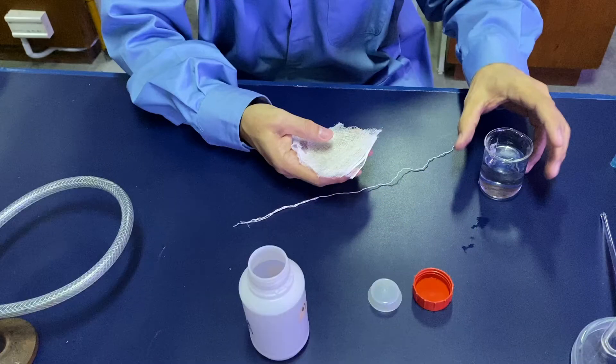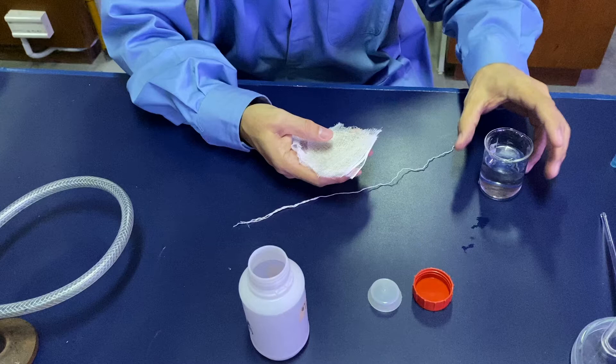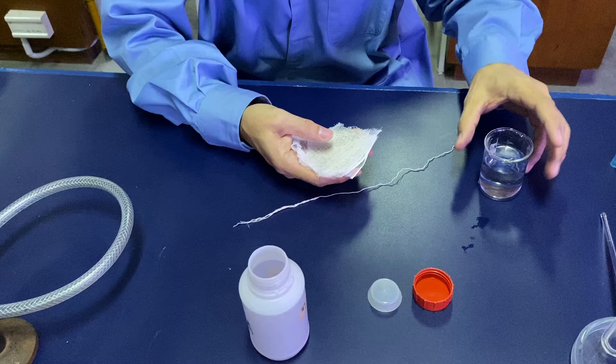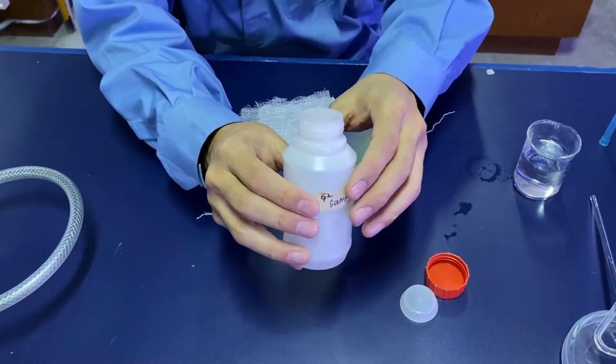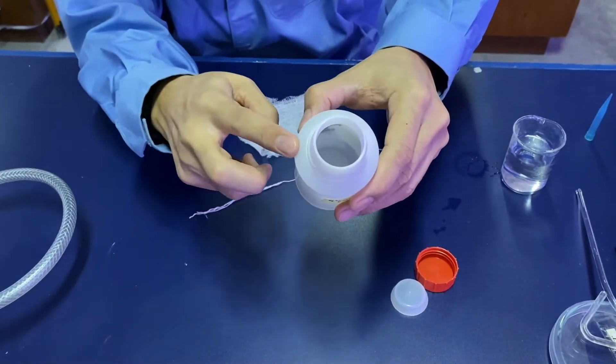For the soil respiration experiments, these are some of the materials that you will require. You will have a gauze and a bottle where you keep your reagents.